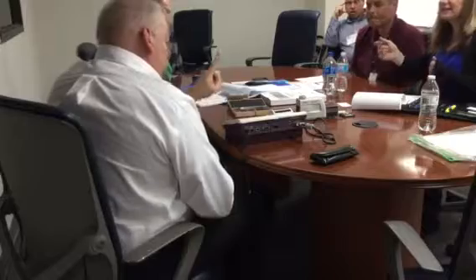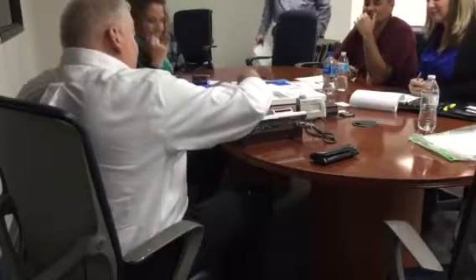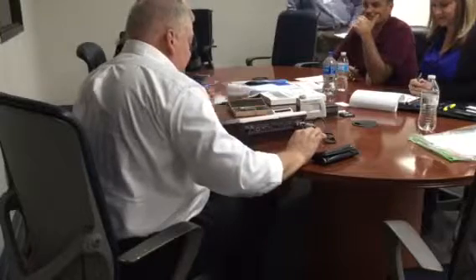2.967. But seriously, now when I hit measurement, I do want you to hit the table. No, wait till the data switches. Go ahead. Oh, look, it showed up. Let's see what value we get. That's why I told you to stay off. Now, Ra, well, that actually affected it pretty severely. Wow, 4%.